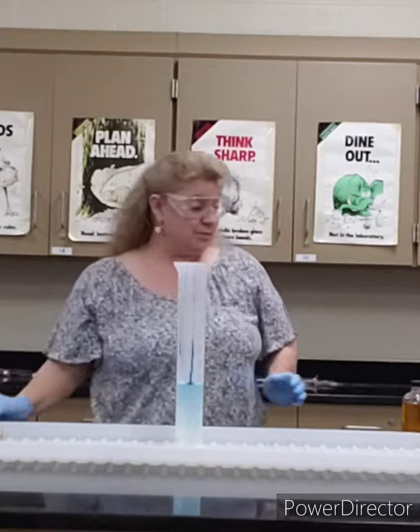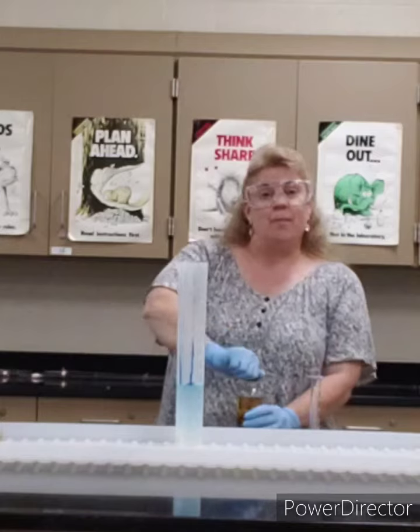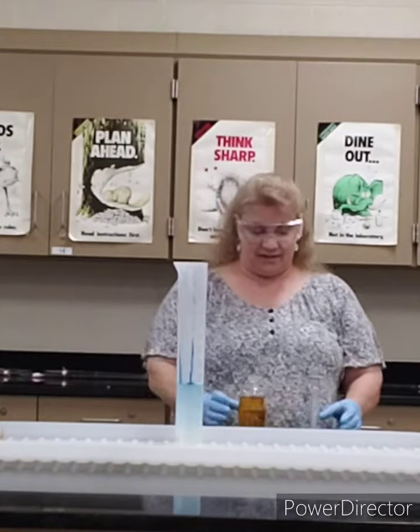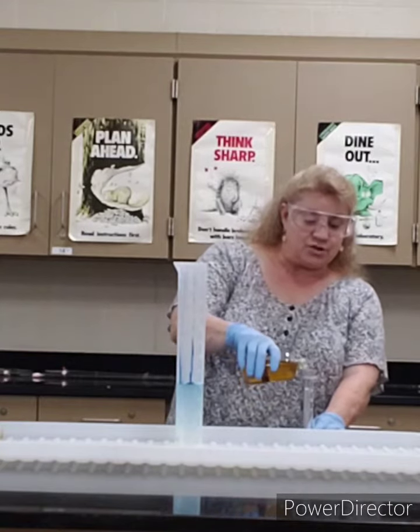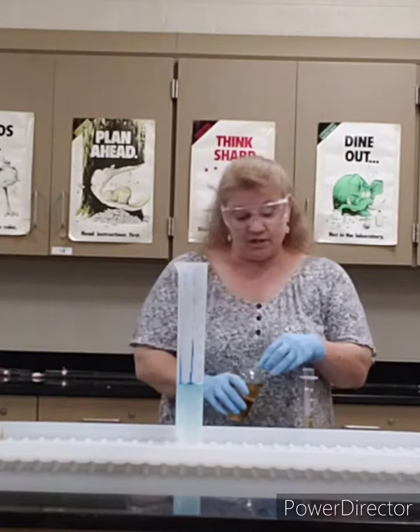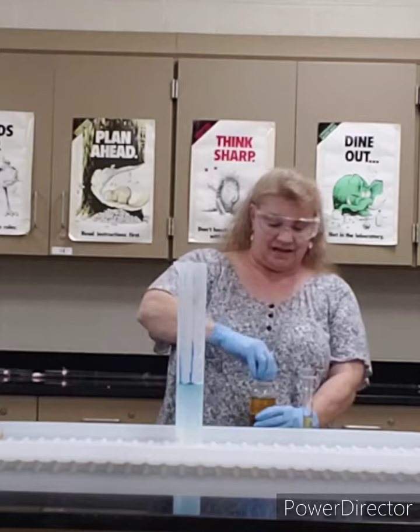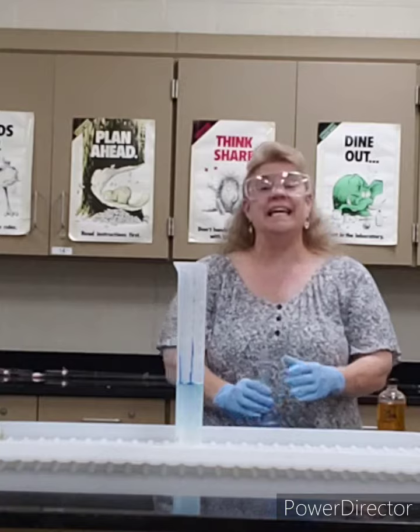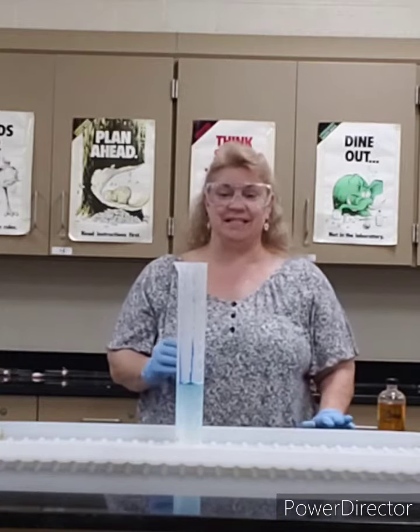Hydrogen peroxide naturally decomposes to create oxygen gas, but we're going to make it happen all at once with this catalyst. This is potassium iodide — a saturated solution, which means we have dissolved as much potassium iodide in this water as we possibly can. That is going to make our hydrogen peroxide decompose instantly and it's going to release a lot of heat. You'll probably see the steam.